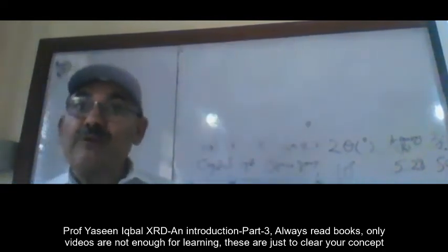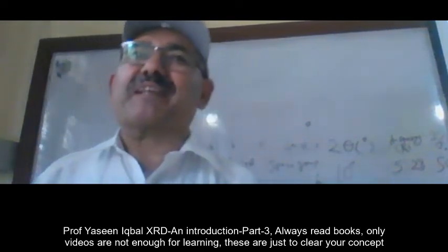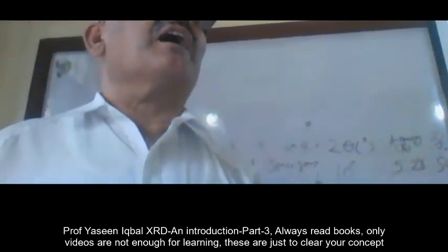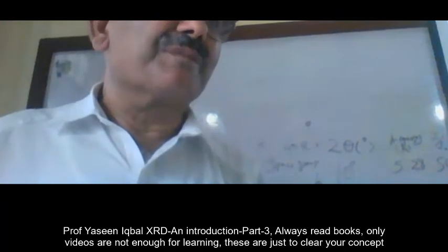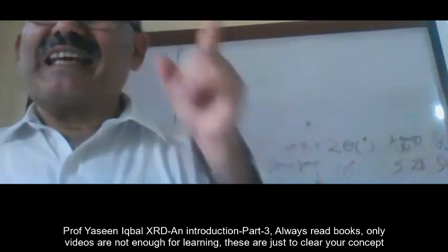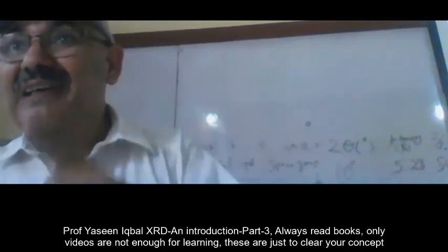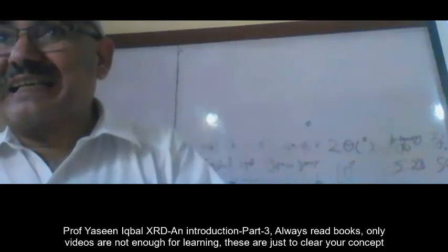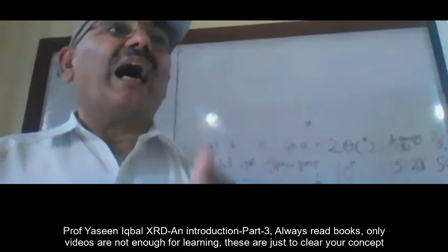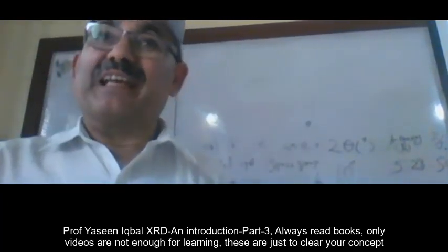So what do you see when you interpret your X-ray diffraction data? You see that all the observed peaks and their relative intensities matched ICDD card number this for barium titanate.